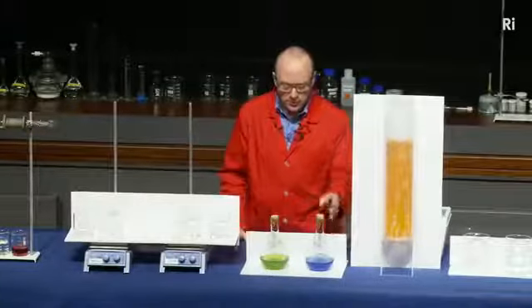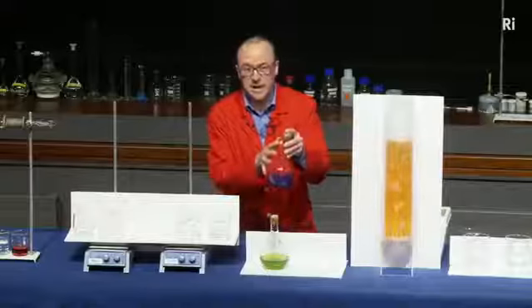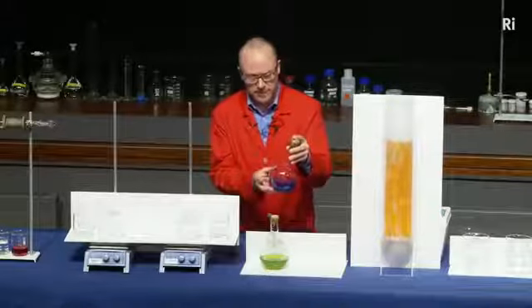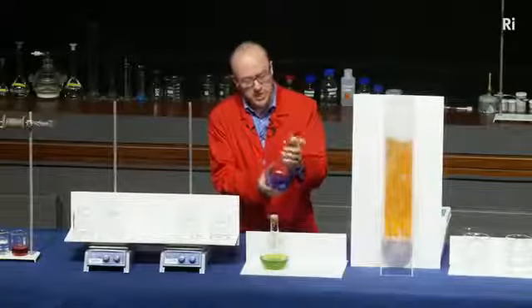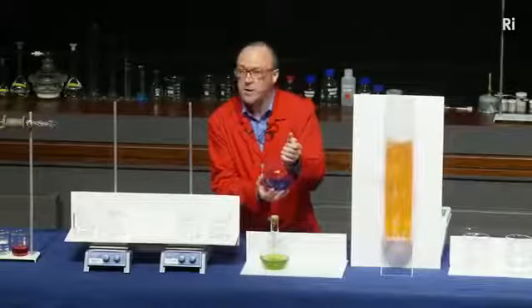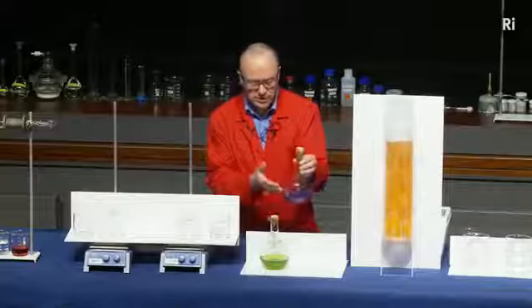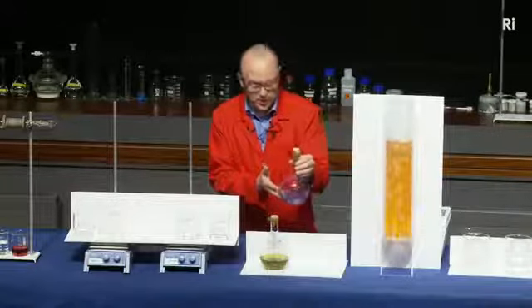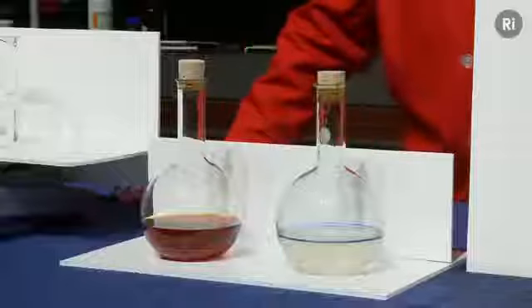What we have to remember, of course, is that this flask not only contains water, but it contains a gas. In fact, the gas is just air. And air, of course, is a chemical. And when I shake the flask, I'm mixing oxygen from the air with the liquid, and that's producing the chemical reaction. So the next question is, did this chemical reaction then go backwards as it fades from blue to colourless? Is it a chemical reaction that's going backwards?